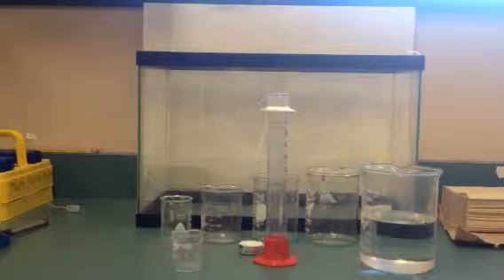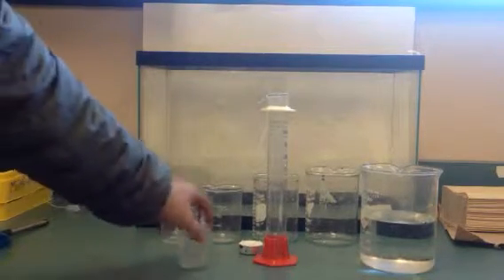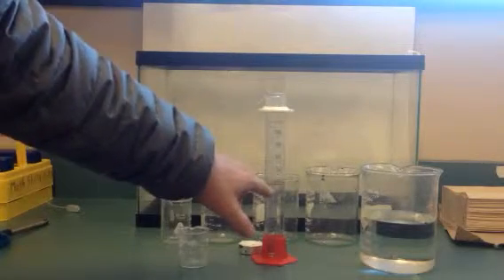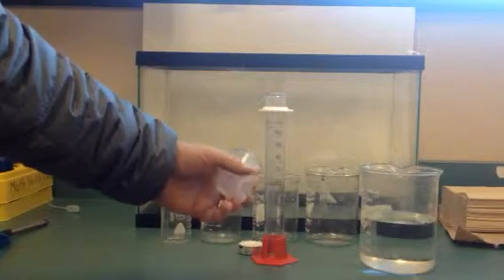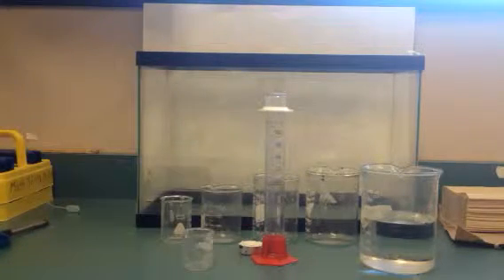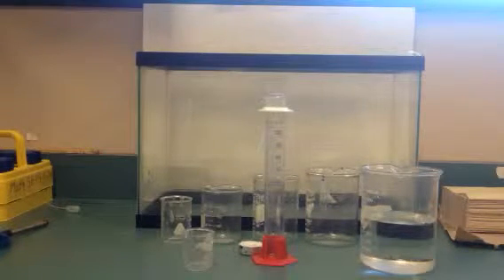Now, like I said, I'm going to put data on the website, so if you missed all this lab, you'll be able to get that data. But let's just pretend it says 60 milliliters. So this 50 milliliter beaker that says 50 on it has an actual volume of almost 60. Again, don't use that number, use the makeup data. But I want to show you how we got the volumes.